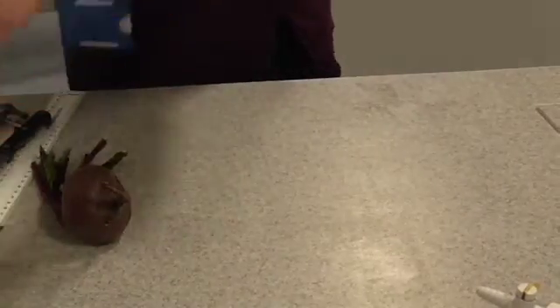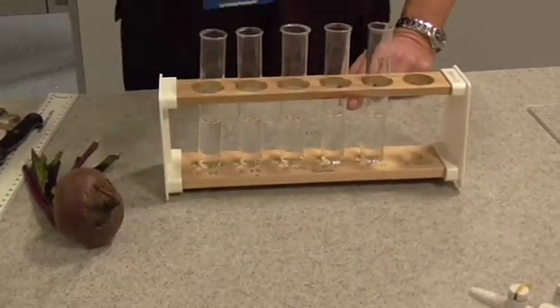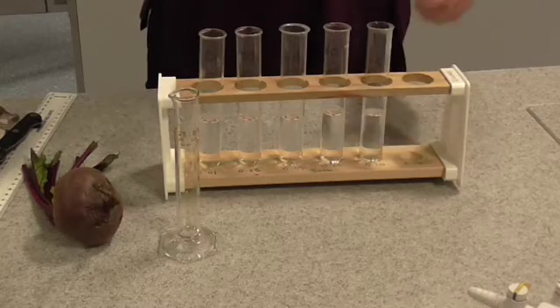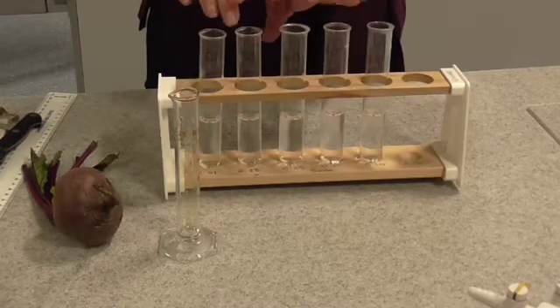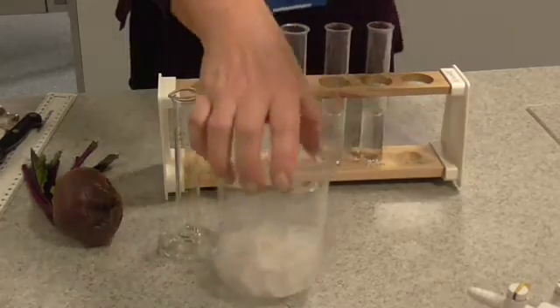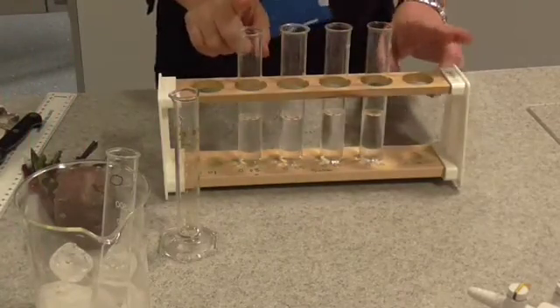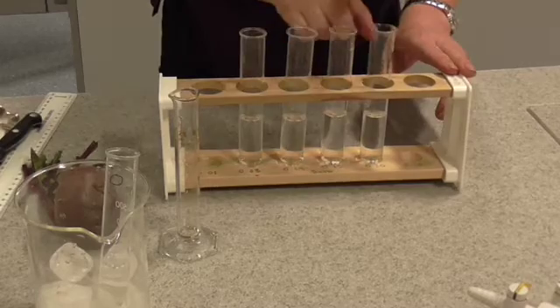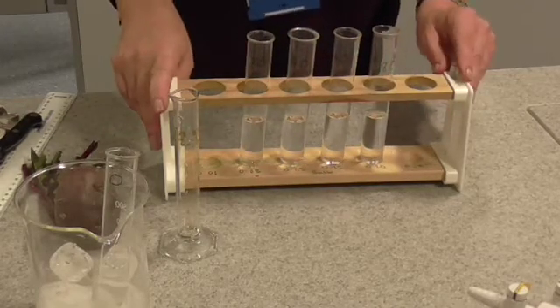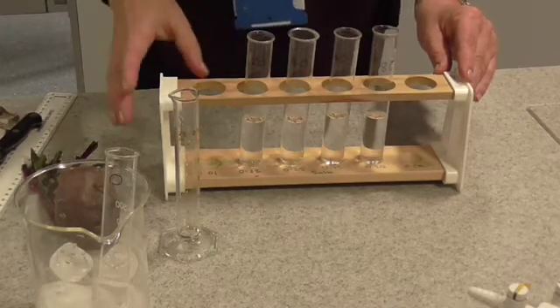The first thing you have to do is get yourself some boiling tubes — all you need is 20 centimetres cubed of water in each boiling tube. You're then going to place these in water baths set at different temperatures. I'm going to place the zero-degree one in an ice bath, and then place the others — at 20, 40, 60, and 80 degrees Celsius — in various water baths, and leave them to equilibrate, in other words to come to the desired temperature, whilst I prepare the rest of the experiment.